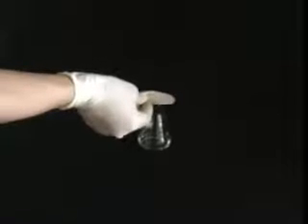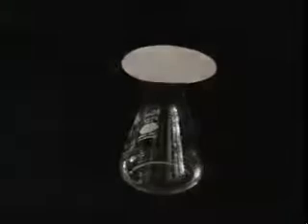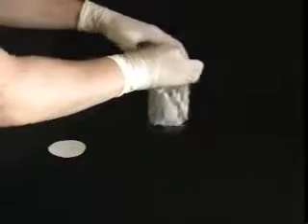Cover the flask to prevent contamination with airborne particles and allow it to cool to room temperature undisturbed. The flask can also be placed in a beaker stuffed with a paper towel to slow down the cooling and promote slow crystal growth. This is especially helpful in a cold laboratory.